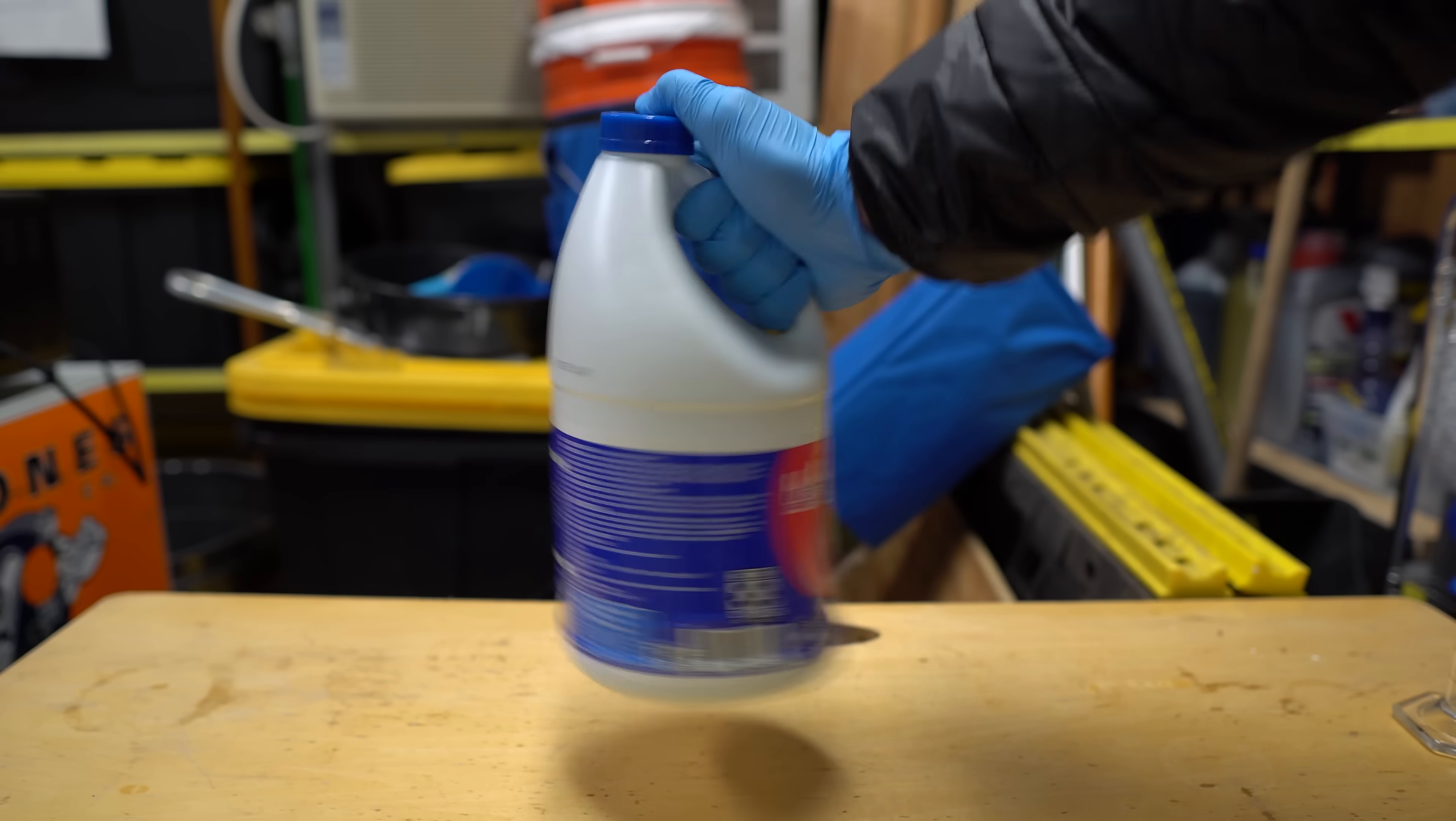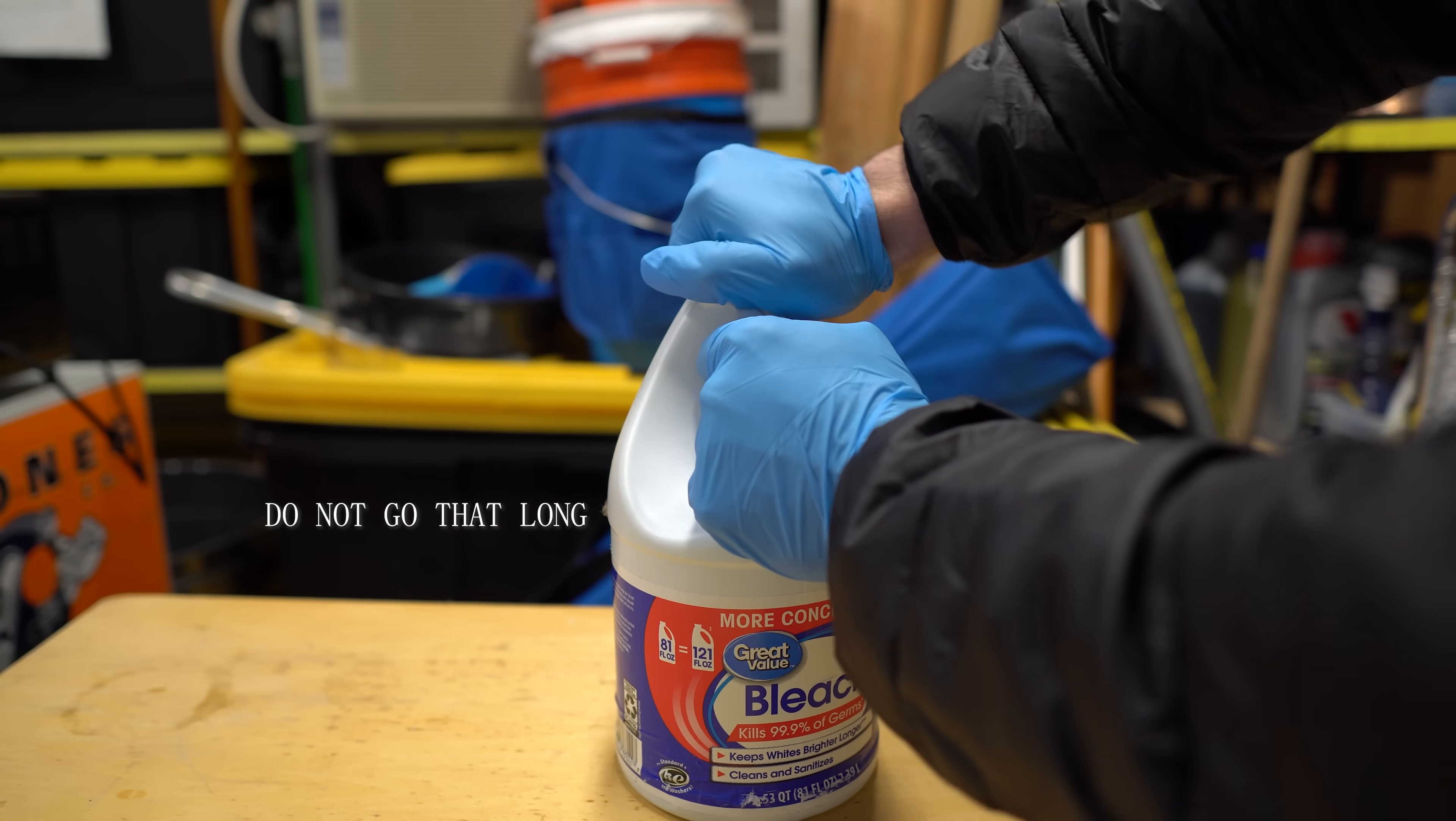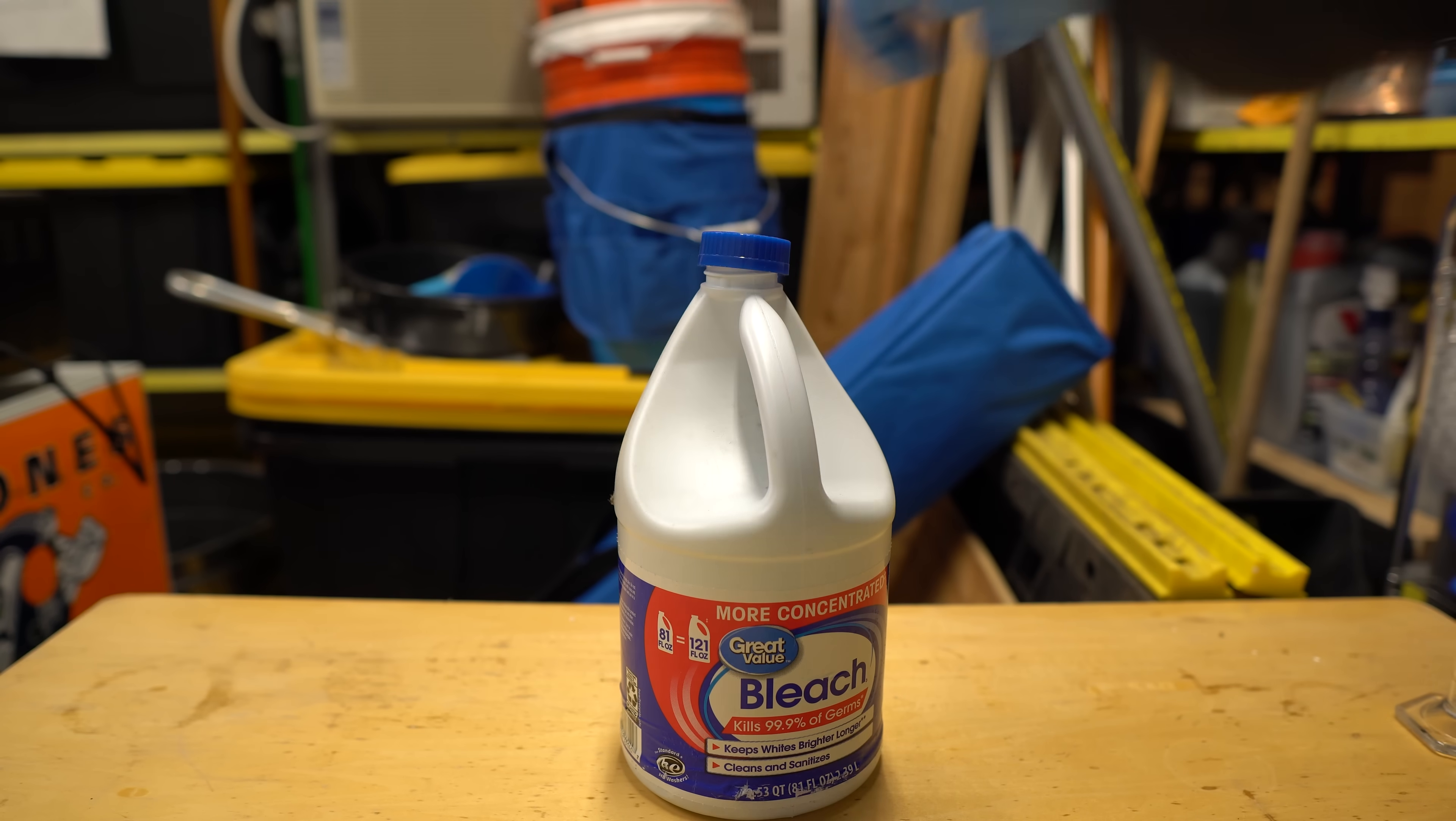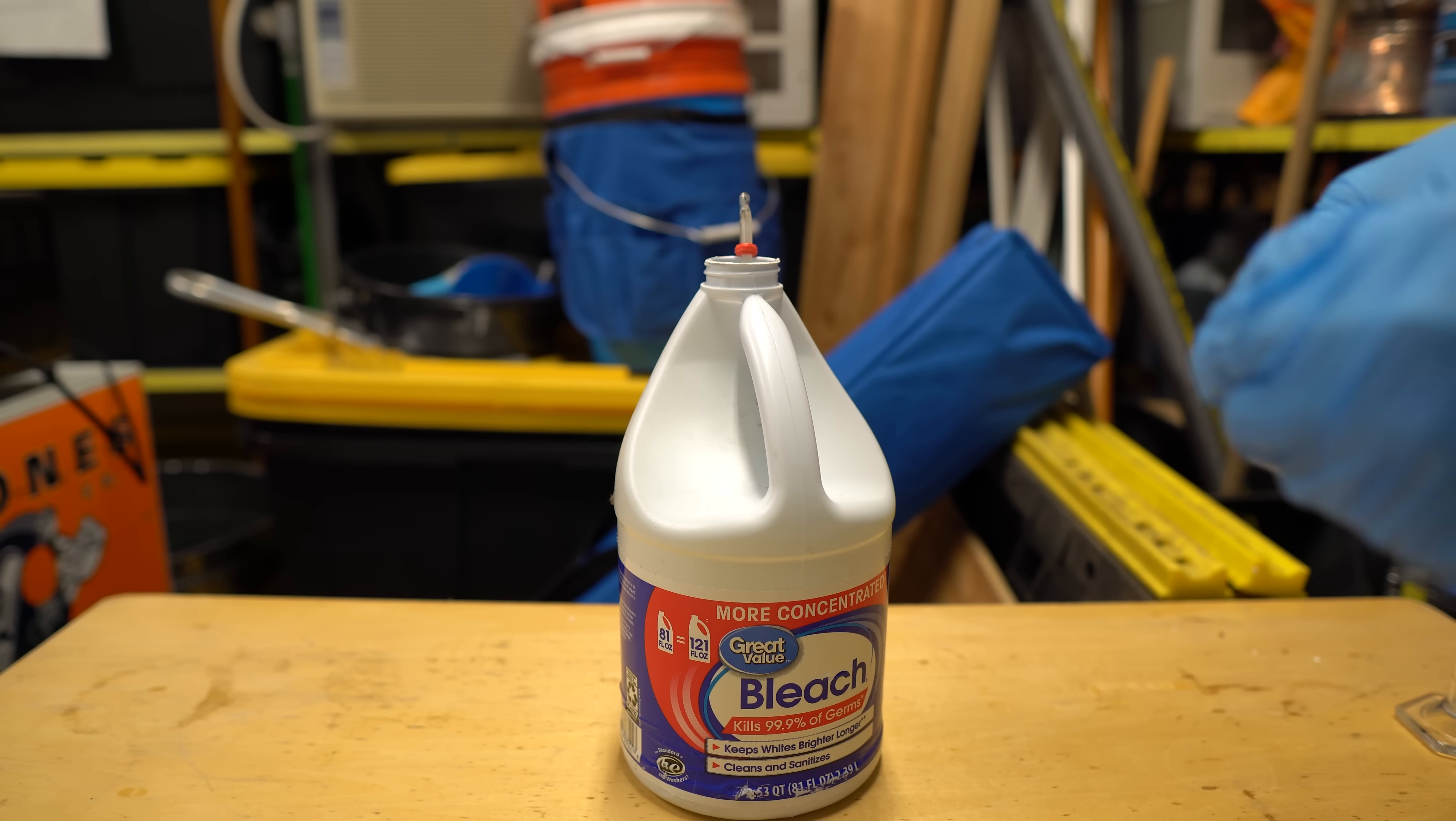Now I think I ended up doing about 36 hours total, but you really don't need to go that far into it. I actually struggled to get this cap off this bottle. It was actually a really big pain to get it off, but make sure that it's not tight so the gases can escape. I checked the temperature again after a couple minutes, and it did not go as high as last time, as this one was even colder than the last one.